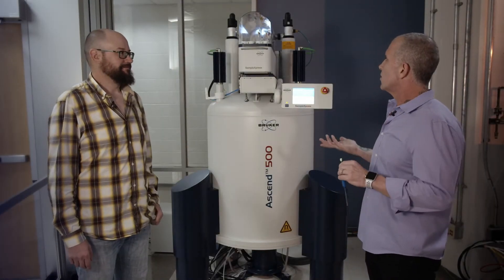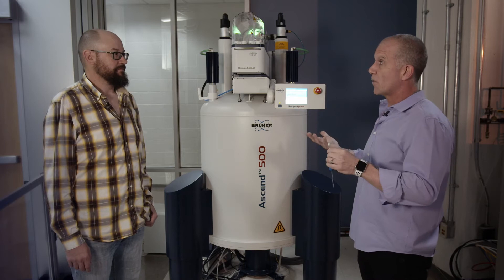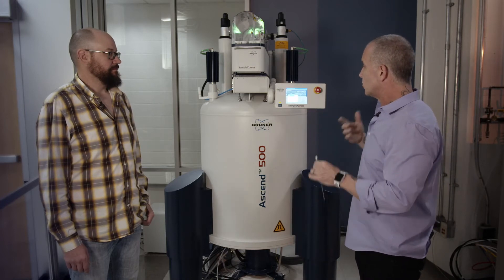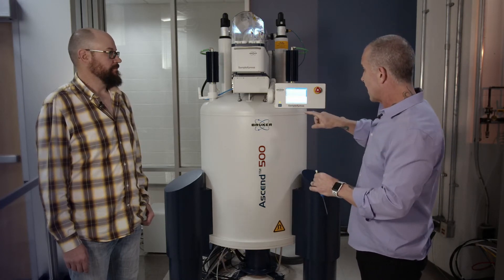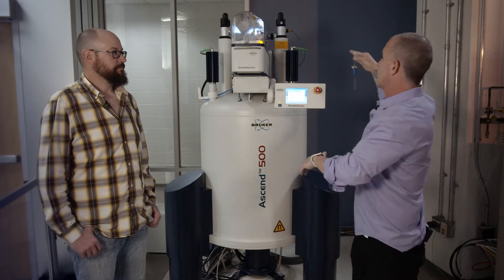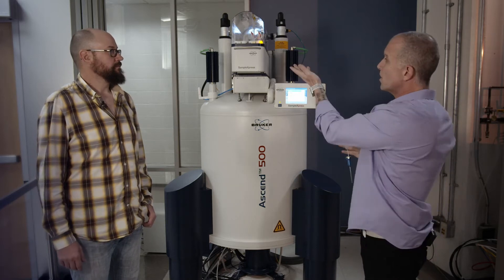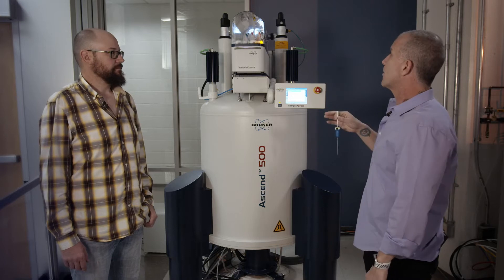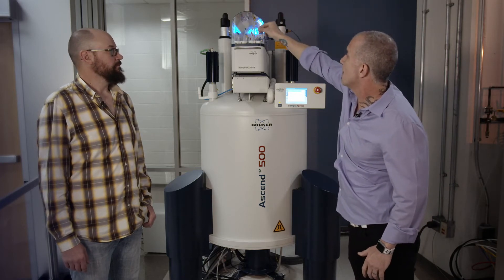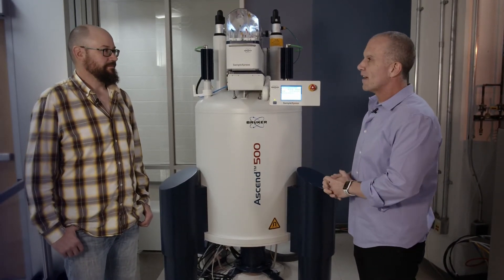So, Brian, as an NMR user, the common interface is sitting at the computer, getting your sample ready, and then once it's ready — like I have a sample here ready to go — it's adding it to the magnet. This one is going in sample number 35. We have a new 500 MHz Bruker system where you can add it to the Sample Express and the data after collected is immediately available online. About the time I put the sample in, that's about the time the average user is done with the instrument.